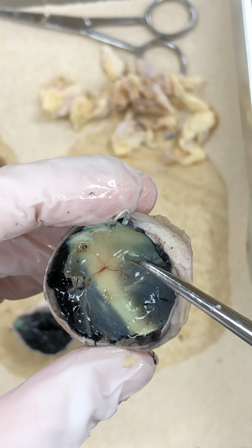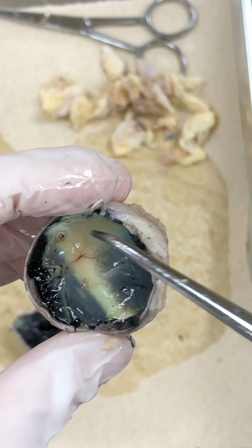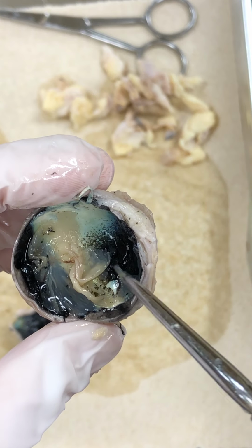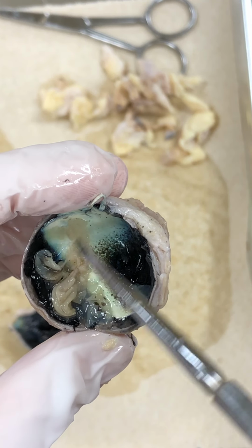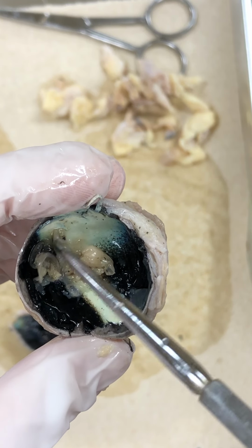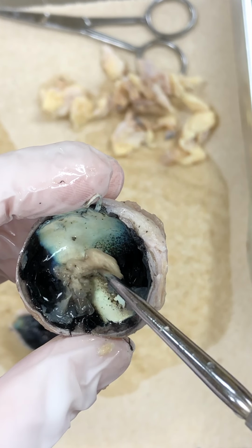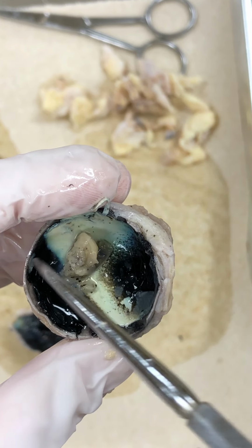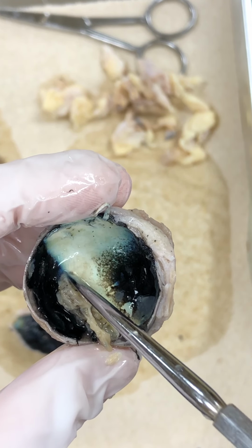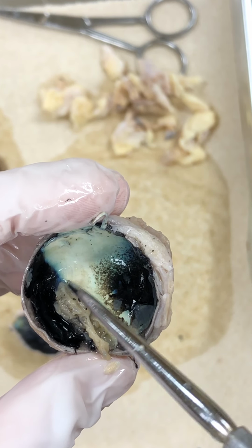This very delicate membrane, it's even a little bit see-through, that is the retina. Okay, now if I disturb it a little bit, well, a lot, and try to gather it, we'll see that it sticks in one spot. As you move it around, where it won't move, you can kind of see it moving around that one spot there, that is the optic disc. Another name for that is our blind spot. It's basically where the retina attaches to the back of the eye, to the choroid, to the sclera.